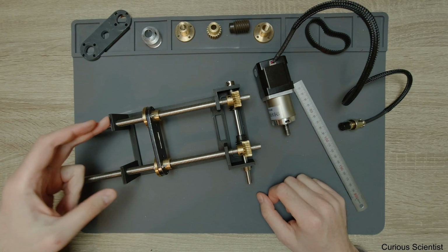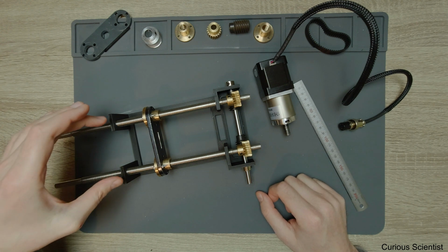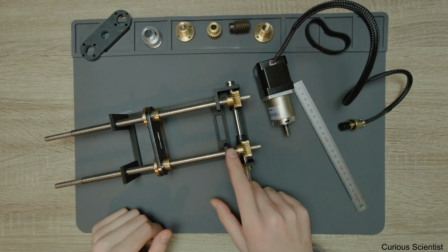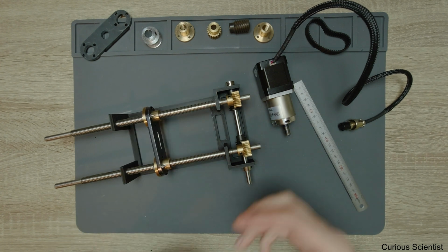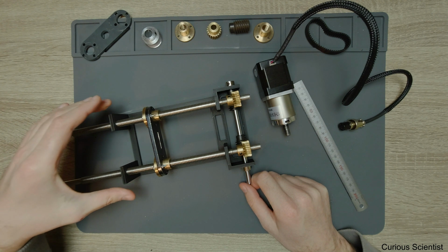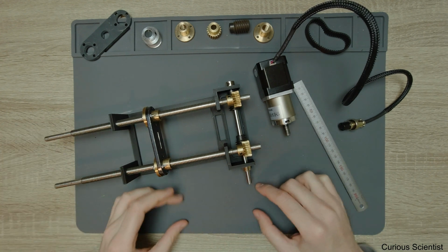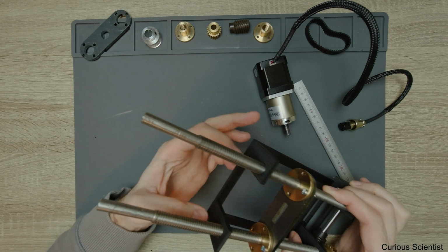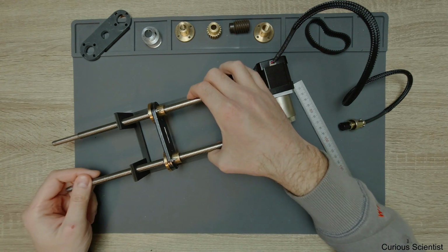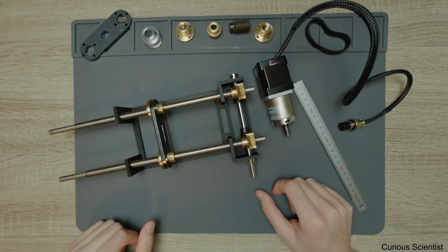This part will be probably done with some regular bearings, because here we don't have to take care of any kind of thrust, because everything is basically handled here, let's say like that. And here we just have to keep the lead screws together, and that's all. So that will be an easy task. I will make a small block here and put some regular pillow bearings here to the two shafts or lead screws, and then it will be just fine. So I think that's all regarding the machine.